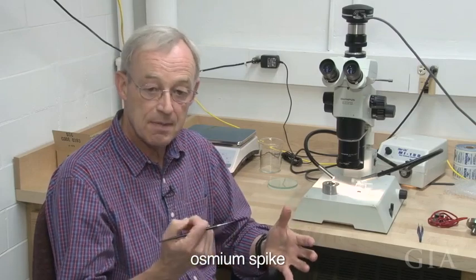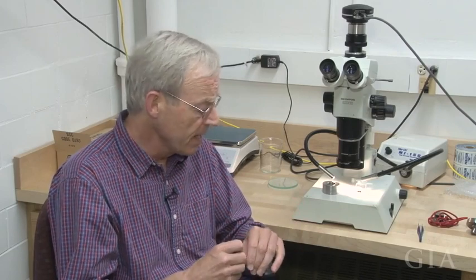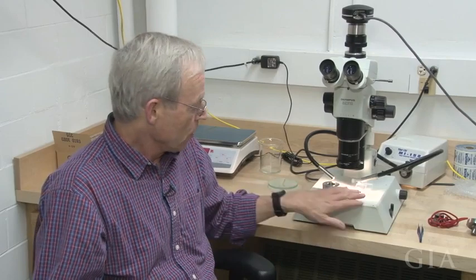And the reason we need to know that is when we go to do our chemistry, we're going to spike the solution that we're going to run with what we call an osmium spike, not radiogenic osmium, but an osmium spike, so we can do the osmium isotopic concentration. And there's about 1,000 times more osmium in a peridotitic sulfide as an eclogitic sulfide. And so you need to use a different spike and a different spike amount if you have one versus the other. And if you use the wrong spike, you've kind of ruined the analysis. So we have to take it over the SEM and do a look at what it is.